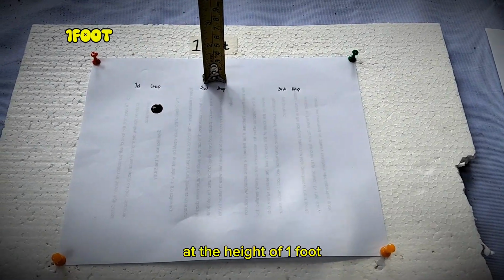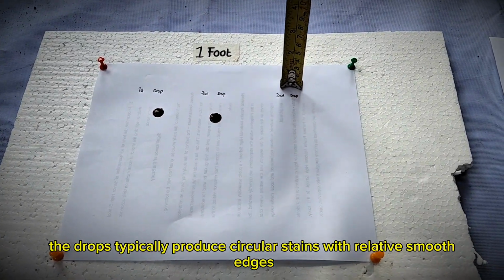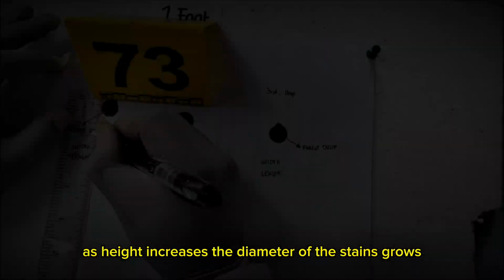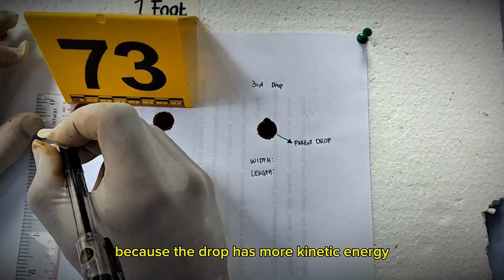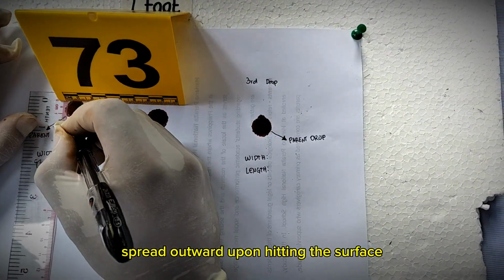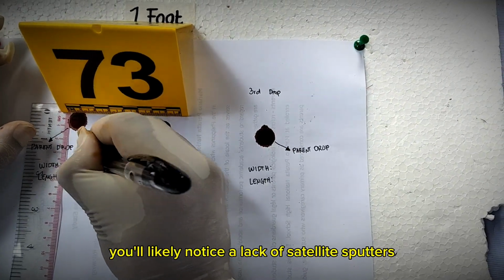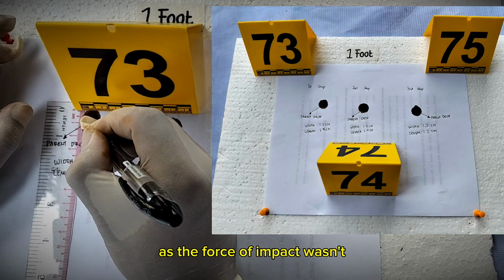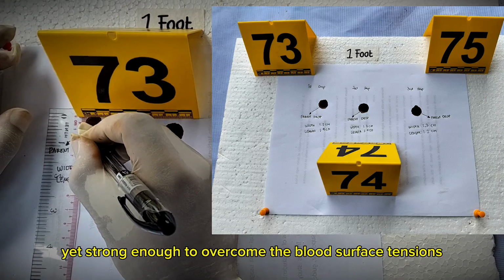At the height of 1 foot, the drops typically produce circular stains with relatively smooth edges because the impact velocity is low. As height increases, the diameter of the stains grows because the drop has more kinetic energy to spread outward upon hitting the surface. At this lower height, you likely notice a lack of satellite spatters, as the force of impact wasn't yet strong enough to overcome the blood's surface tension and cause it to rupture.